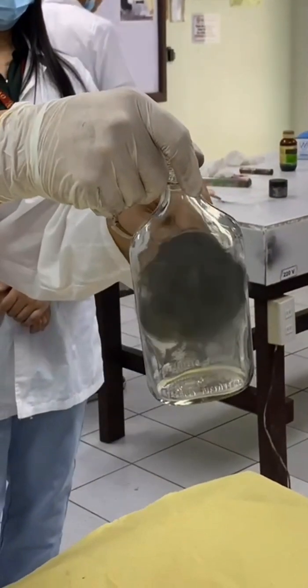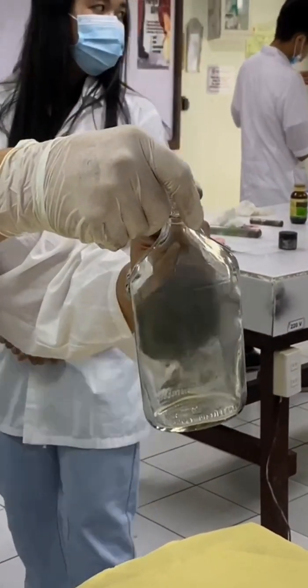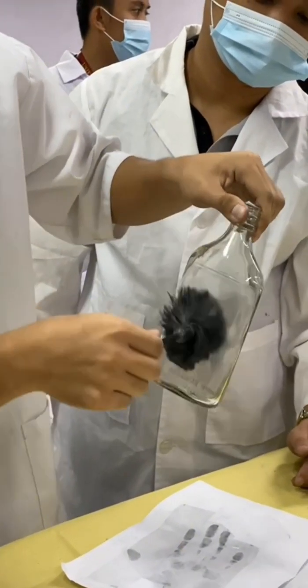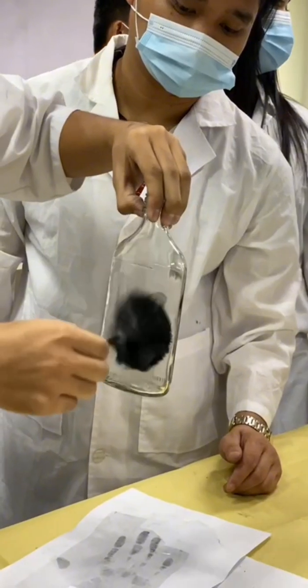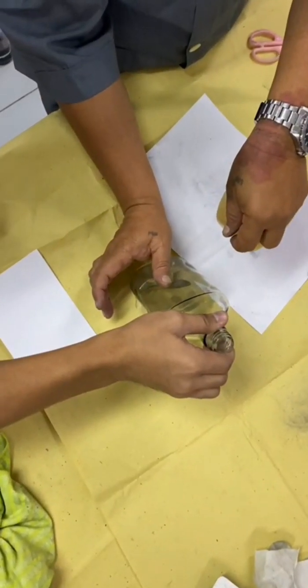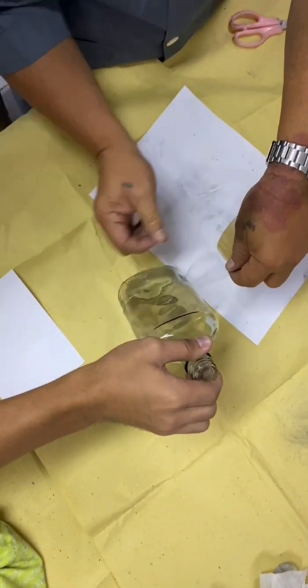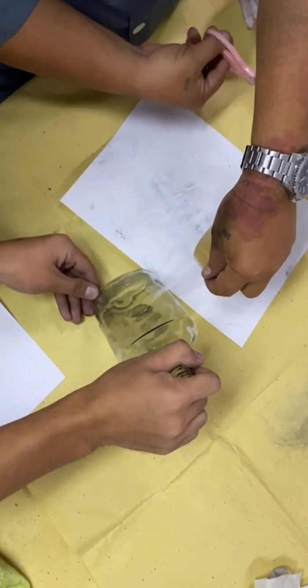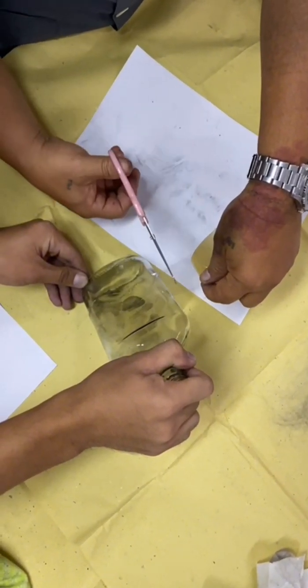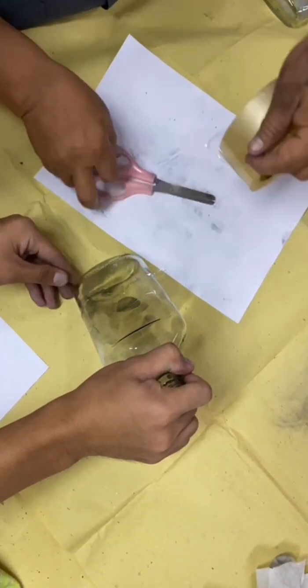First step, we pressed our fingers on a clean piece of paper to leave a latent print. Next, sprinkle the black powder on the paper and sway it gently back and forth. This motion allowed the powder to adhere to the fingerprint residue, making the latent print visible. After swaying the paper, the latent print appeared clearly against the white background. We then examined the developed prints for patterns and clarity.